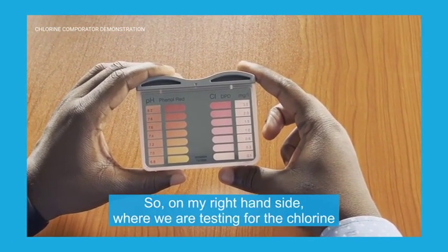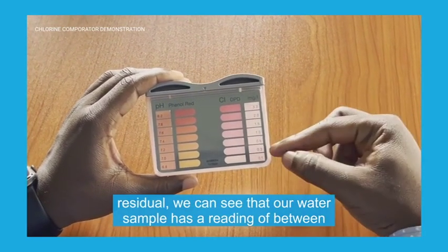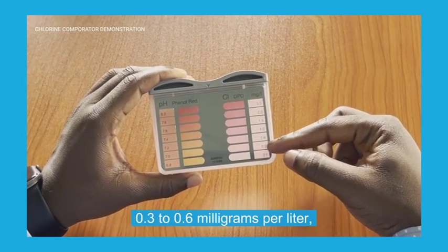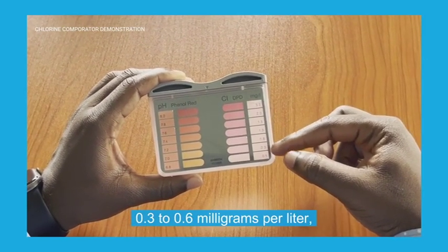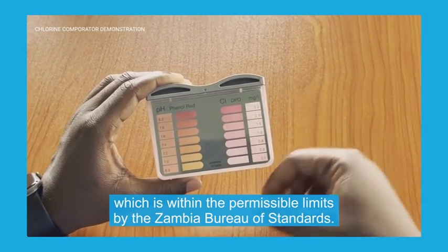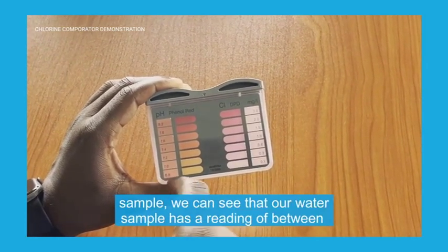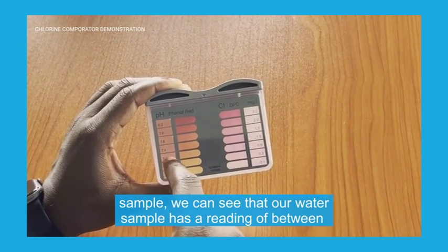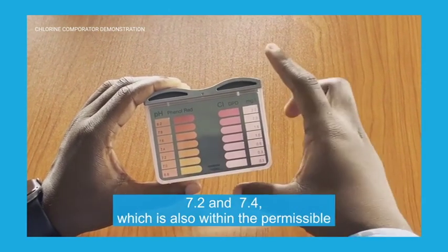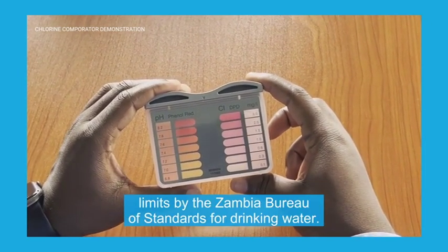On my right hand side where we are testing for the chlorine residue, we can see that our water sample has a reading of between 0.3 to 0.6 milligrams per liter, which is within the permissible limits by the Zambia Bureau of Standards. Moving to the pH level, we can see that our water sample has a reading of between 7.2 and 7.4, which is also within the permissible limits by the Zambian Bureau of Standards for drinking water.